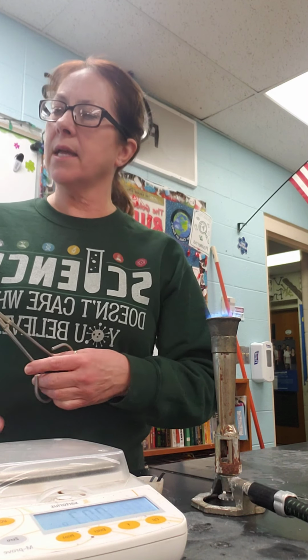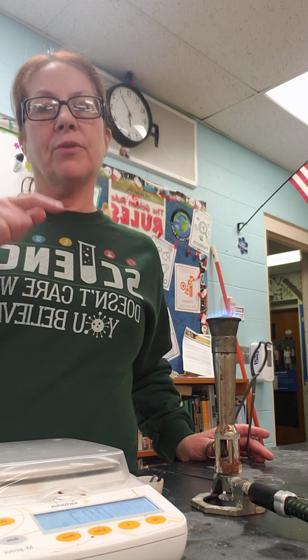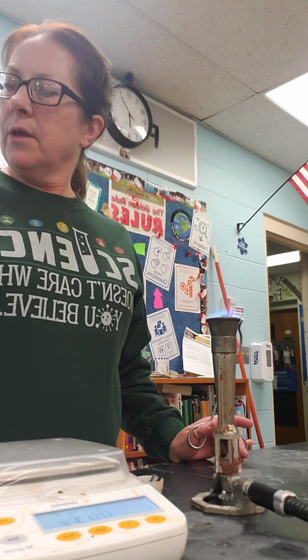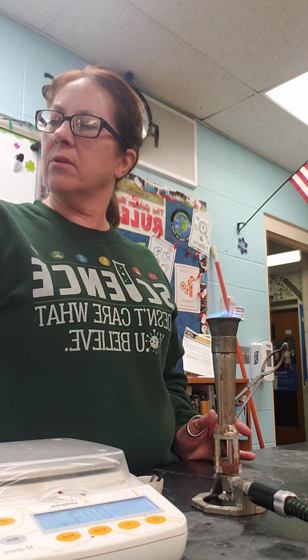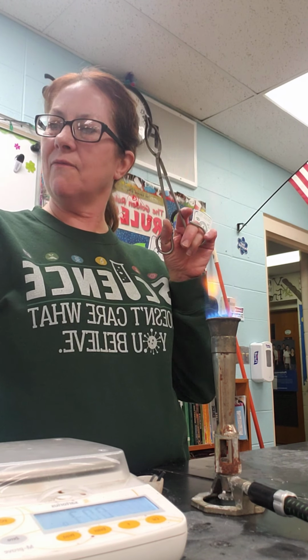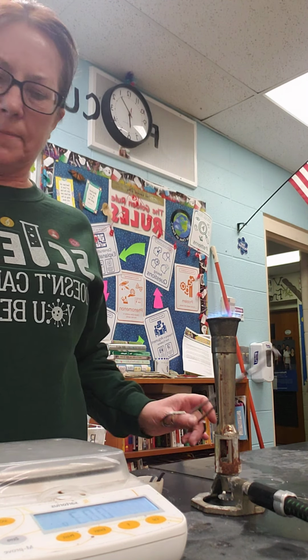I want you to look at the objective. I'm going to do two reactions, and you should record both qualitative and quantitative data. Just do it in the margin of your textbook or somewhere in your textbook. And make sure to record how you know that you saw a chemical change happen. Your research question: how does the flow of energy and matter in chemical reactions in an open and closed system differ? And make sure that you develop a visual model to explain your findings. Okay, so let's get going.